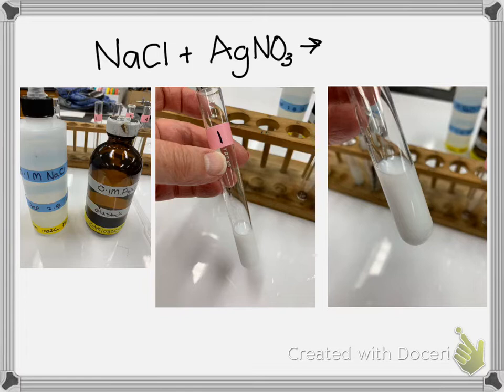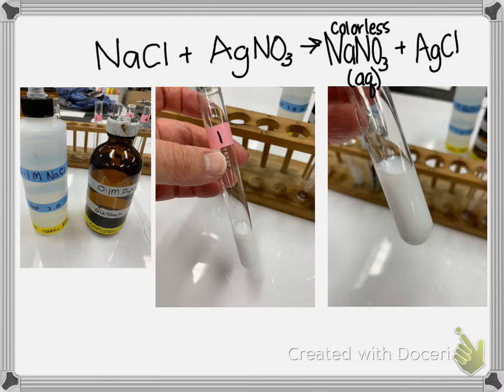And when they mix, and this happens instantaneously, I get this white milky solution. So when they switch partners, sodium nitrate is still a solution. So that's the liquid, and it's colorless. So that we don't really see. But silver and chloride, when they switch partners, so sodium goes with nitrate, and that's a colorless solution.